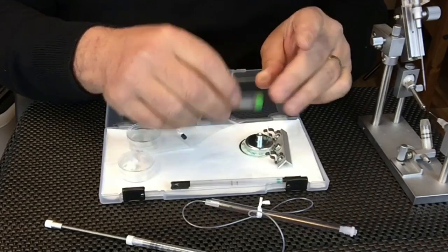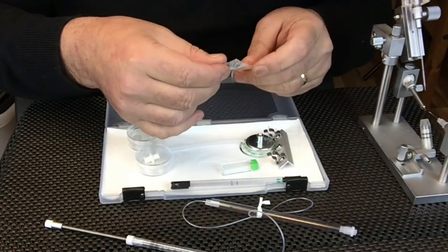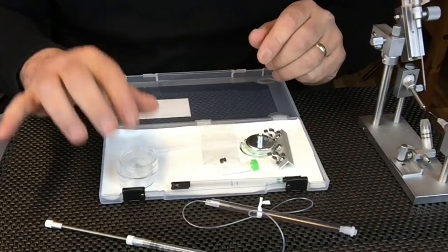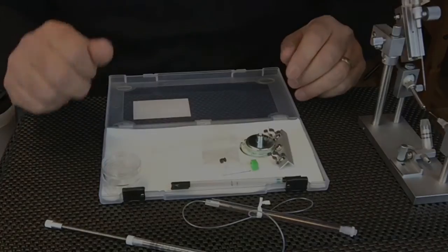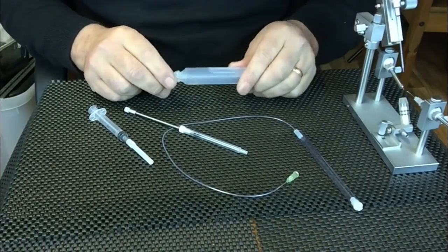Five glass tips, some spare tubing, a grommet for the inside of the syringe, and an adapter. We'll come back to the adapter later. First, we will fill the syringe with saline solution.